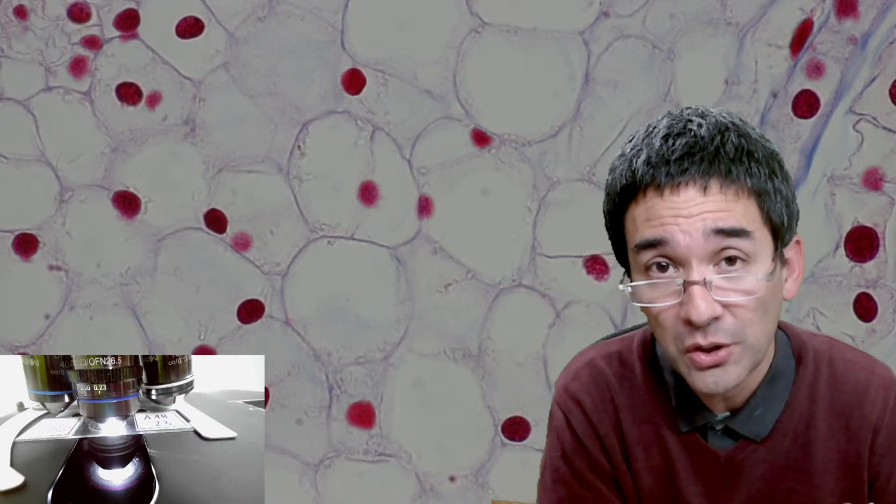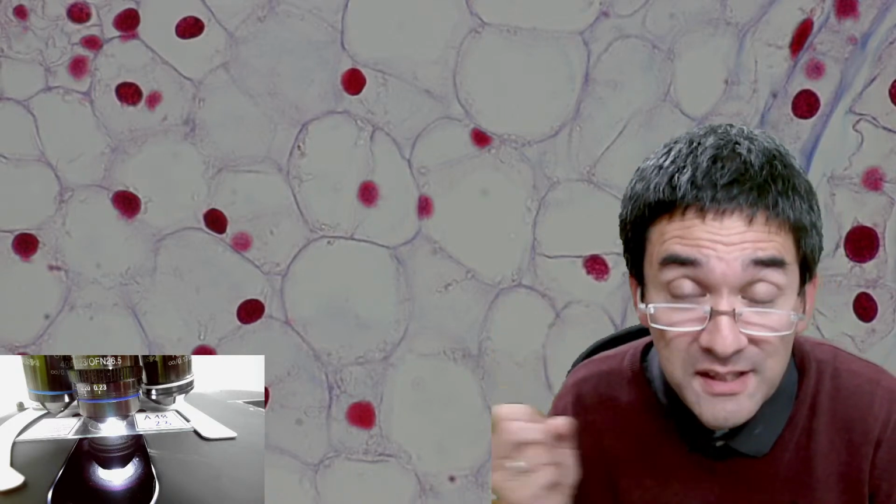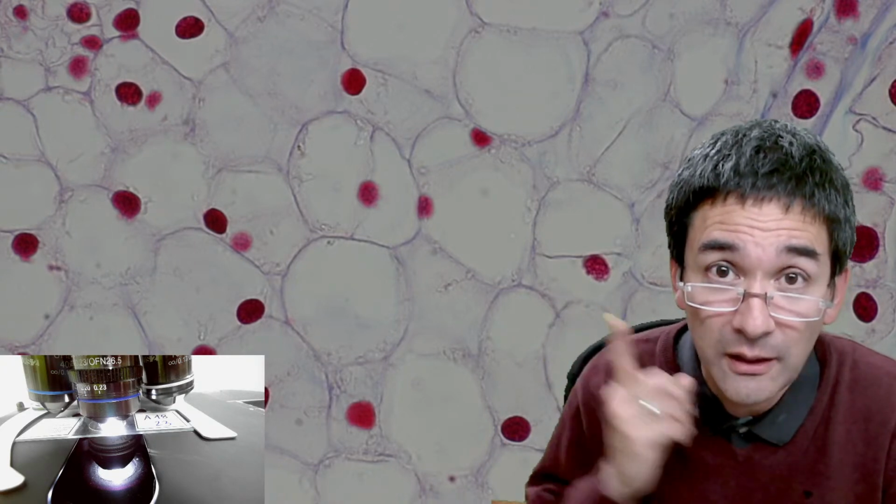Another side track. Okay, if you look here, for example, again, that's a plant cell. You see these are the cell walls, right? Okay, we see the nucleus because it has been stained. But the early microscopists essentially were immensely fascinated by the cell wall of plants, because that's the thing that they could see. They could not see all the inside. The microscopes weren't good enough yet. Maybe they didn't have the staining available yet. So they were massively interested in the cell wall.